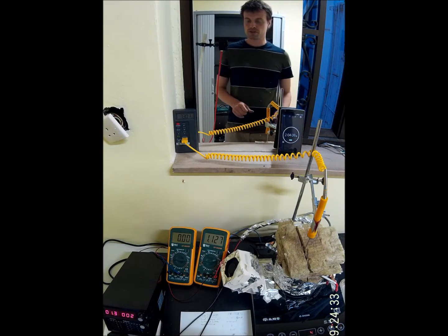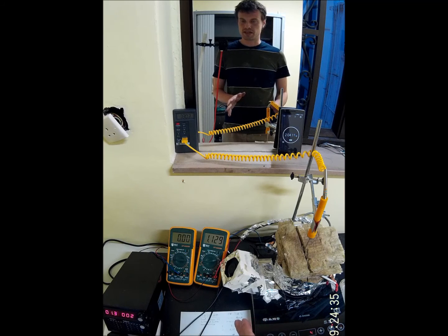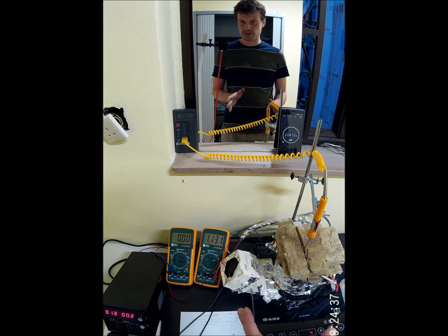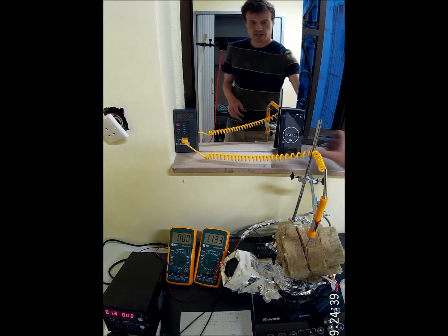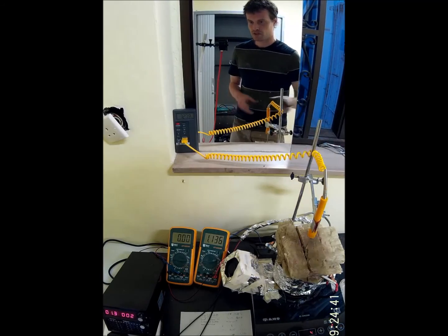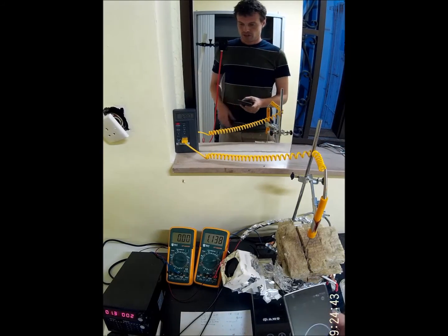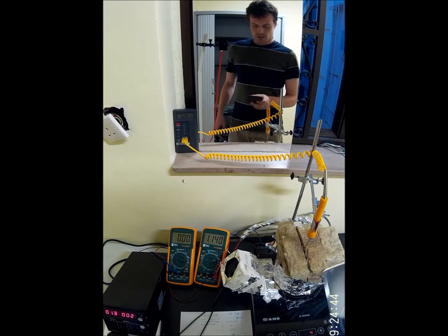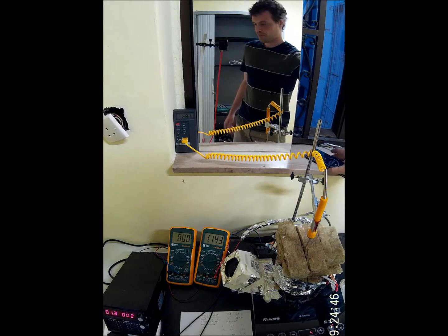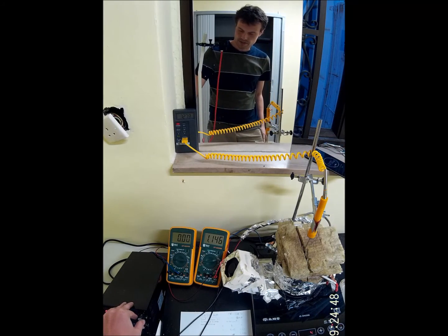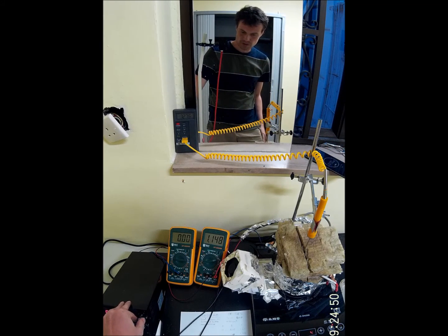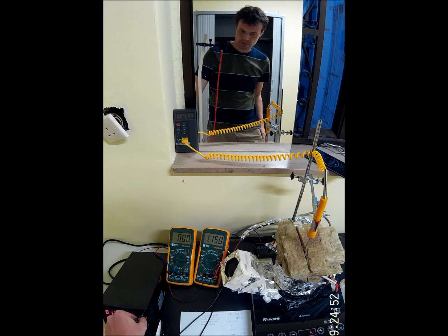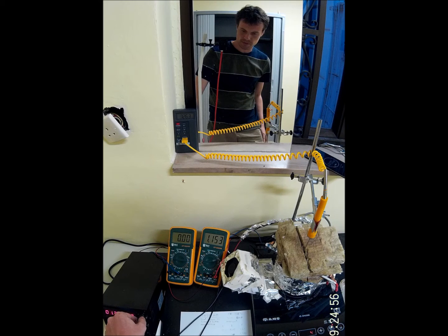This time I'm going to try to have the temperature between 730 and 740, and I'm going to have a bit longer low current step. I'm going to have 30 minutes at 50 milliamps.